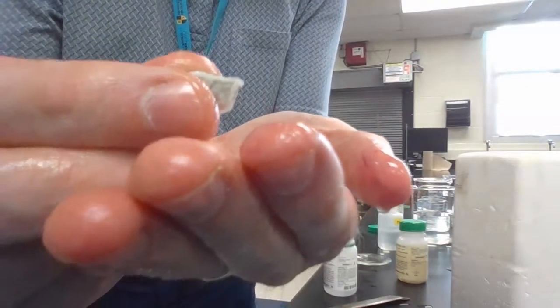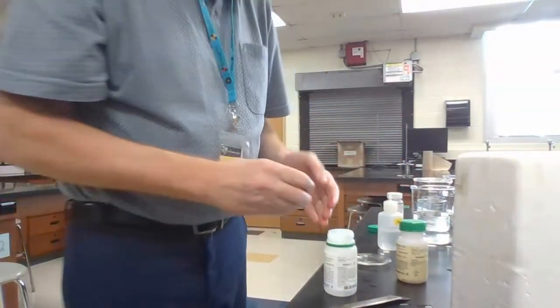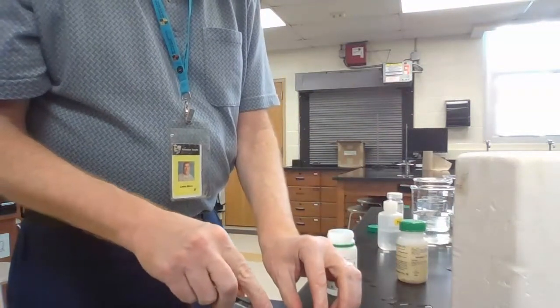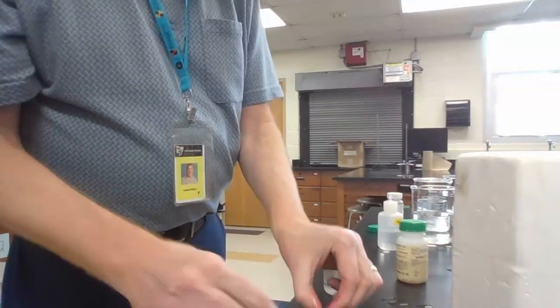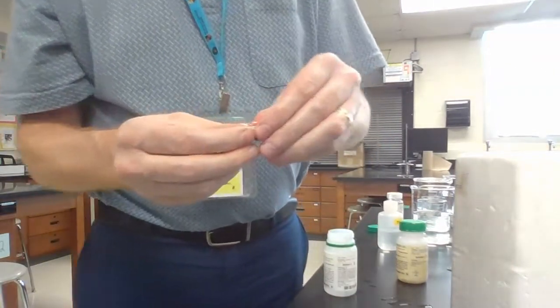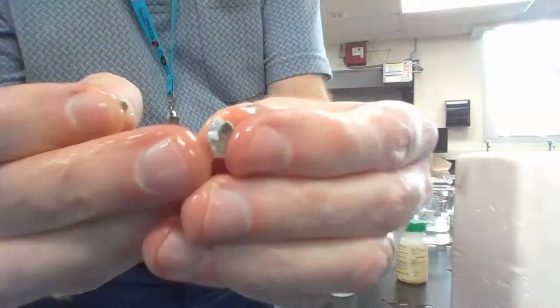Thanks. So this is our weird piece of sodium there. Or sorry, potassium there. Potassium, right? Potassium, yep. I'm going to try to open this up so you can see what it looks like inside. Oh, gosh, that cuts so easy. I don't even need that to cut. It actually opens up really well. Wow. This is not really easy to see, but it's very shiny inside.